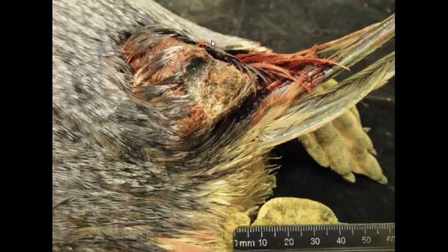You could have called this a uropygial or a preen gland carcinoma for full credit. They often also will throw squamous cell carcinomas out of this gland. Because it's a mixed squamous and sebaceous gland, it can look a little bit like either. So either uropygial squamous cell carcinoma or uropygial carcinoma, I'm perfectly happy with.